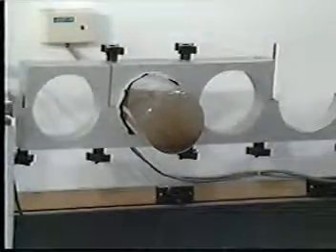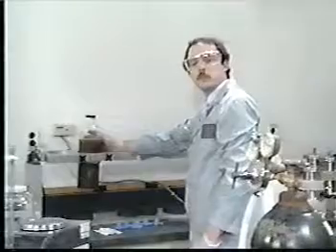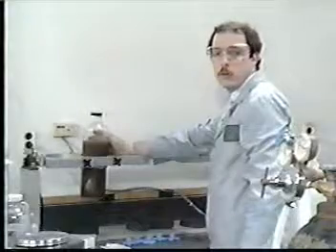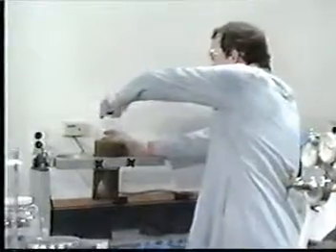Rotate it in an end-over-end fashion at 30 plus or minus 2 RPM. For some types of waste, pressure may build up within the bottle from gases evolving out of the extraction. Since volatiles are not of interest here, the bottle may be periodically vented to relieve the pressure. The bottle continues tumbling for 18 hours.